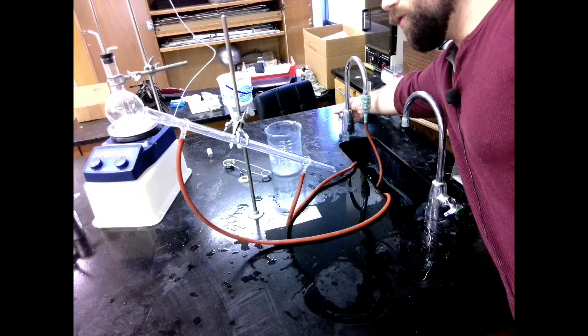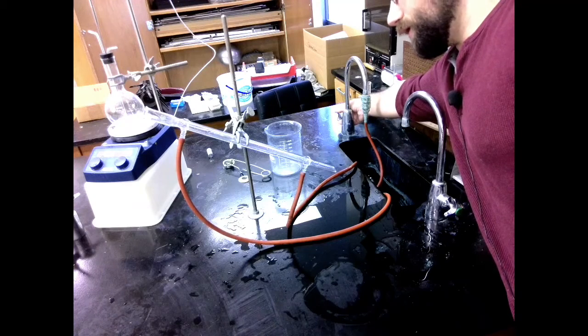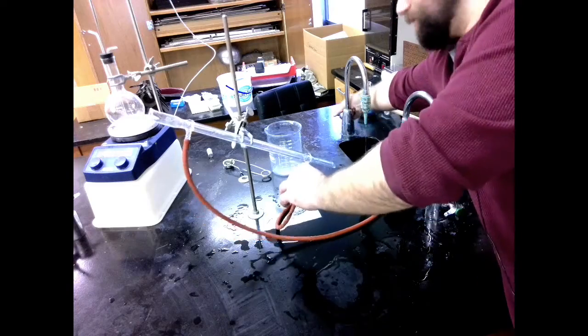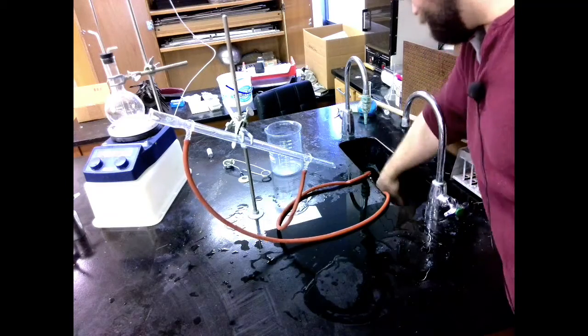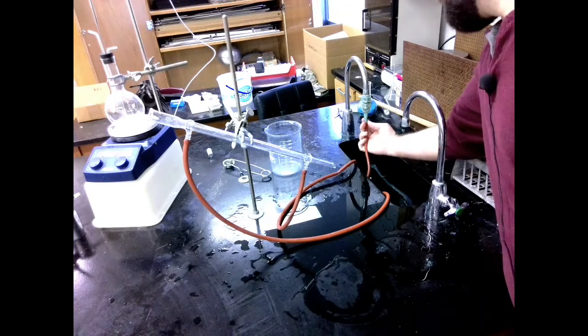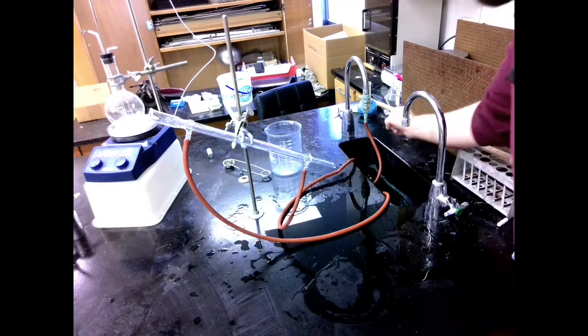Just so you can see what it looks like. If I keep pushing more and more, eventually my pressure gets too high and my hose will break off. That's why we want to keep a low amount of water on this.